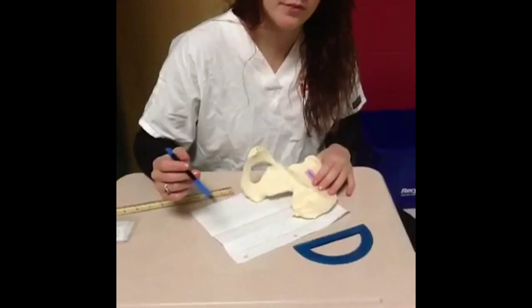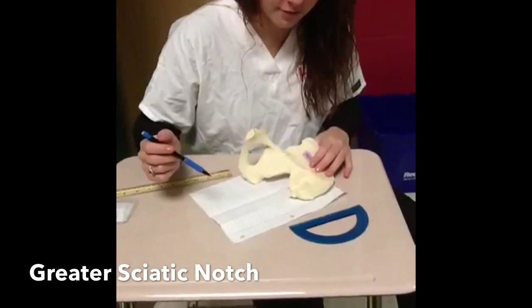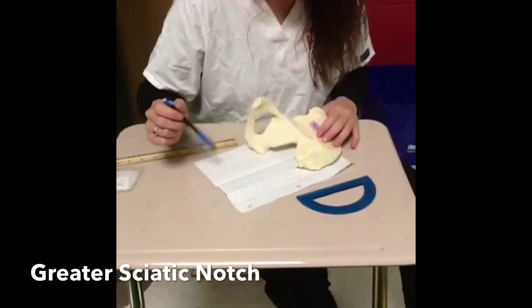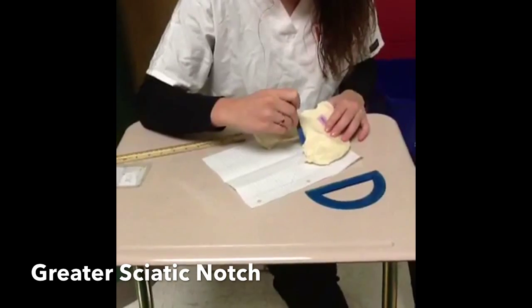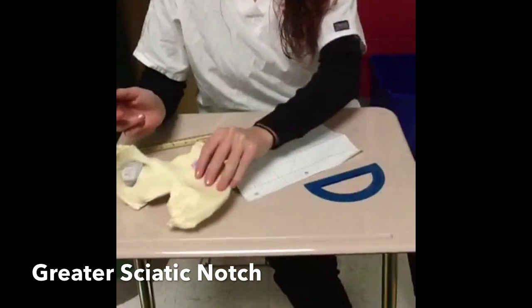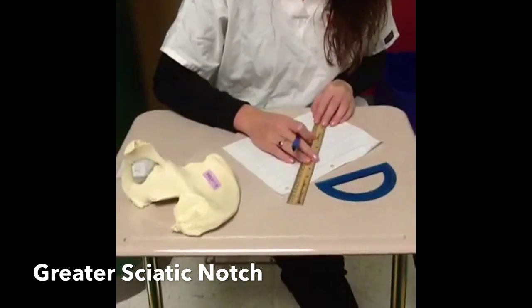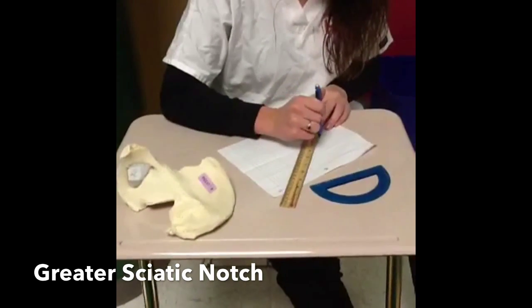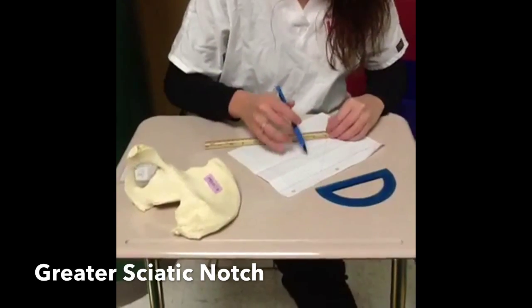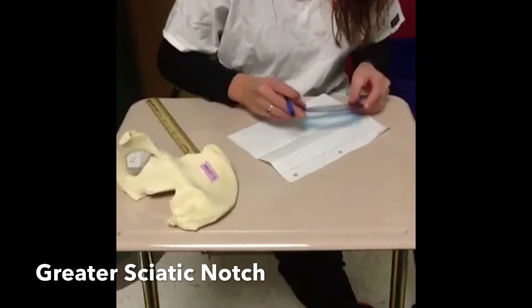Greater sciatic notch: place the pelvis posterior side down and turn it so the greater sciatic notch is flat against a sheet of paper. Trace the angle of the notch onto the paper. Use a straight edge to extend the lines until they meet to form an angle. Use a protractor to measure the angle you have just drawn.